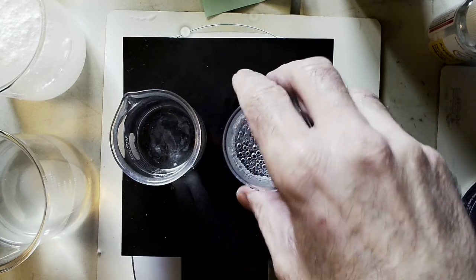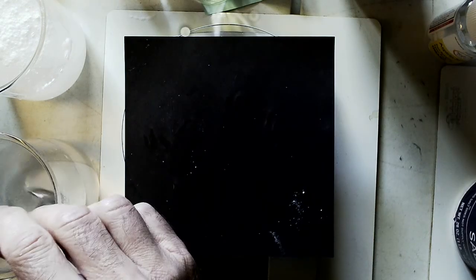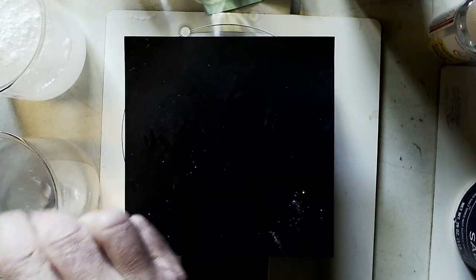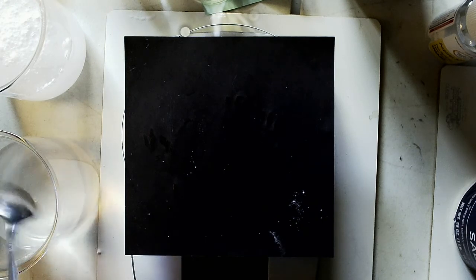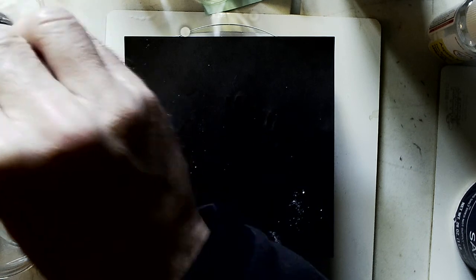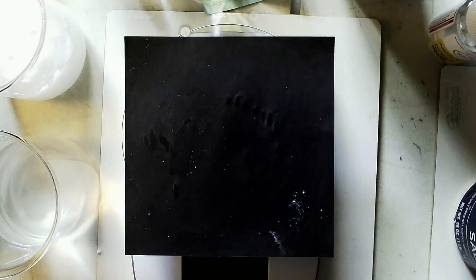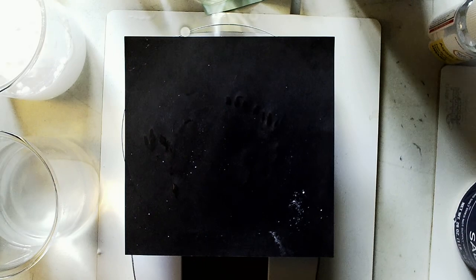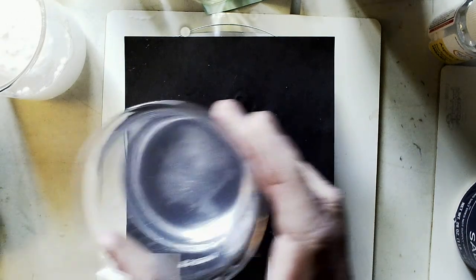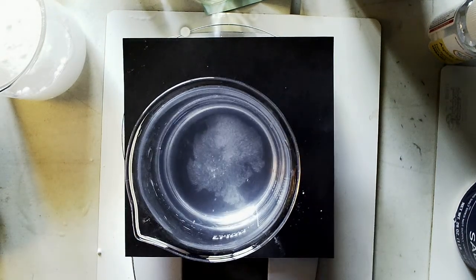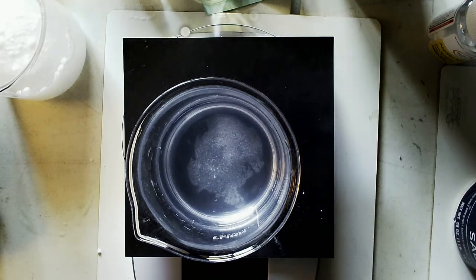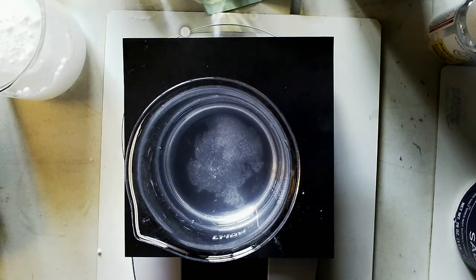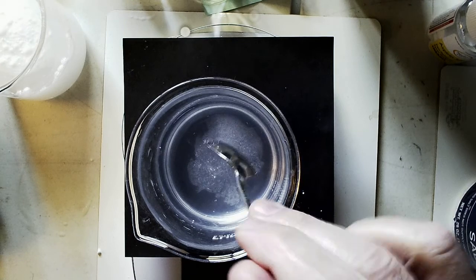So let's go ahead and look at our salt and aspirin mixtures over here. I'm going to give each one of them another little stir and let it settle for a little bit. So here is my salt, and that is why I used the black paper on the scale, so you could see the salt settling at the bottom.